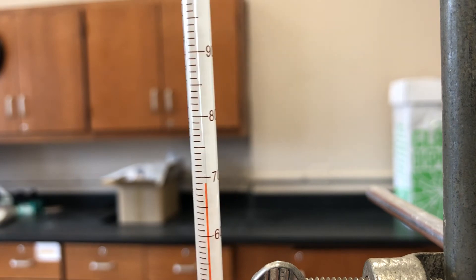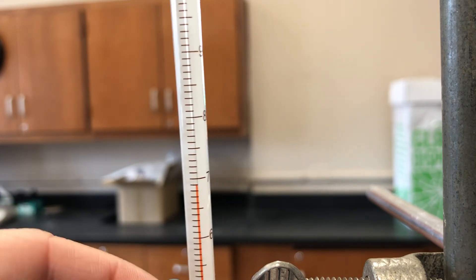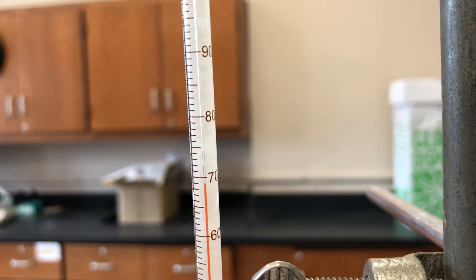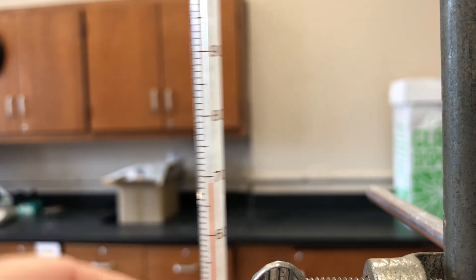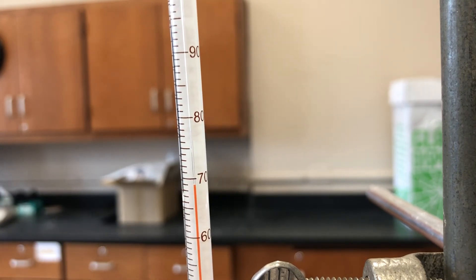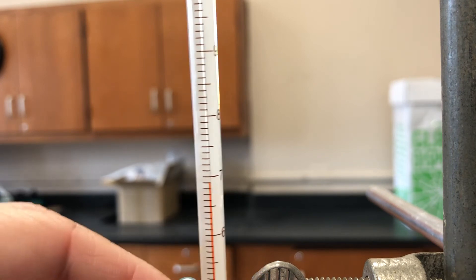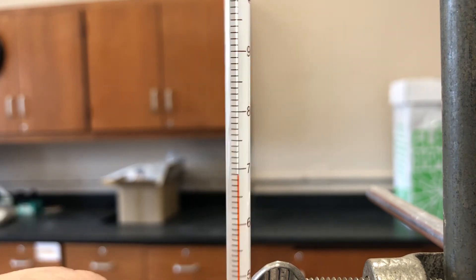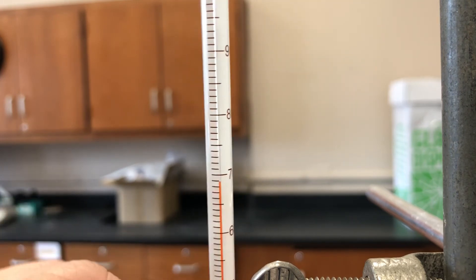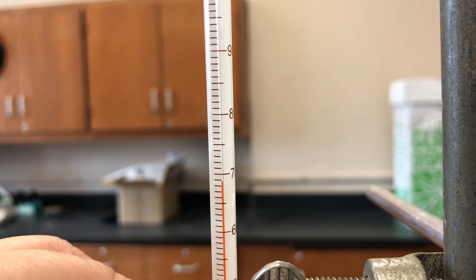Getting really close — I think we're almost to our four plateau points. I'm going to start watching that. It's getting real tough to stir with the stir rod at this point. On your data sheet it has the little chart for the time and temperature. If we go past that, just fill it in at the end — you can add some more lines, it's fine.